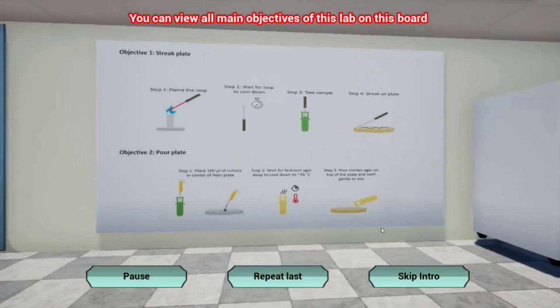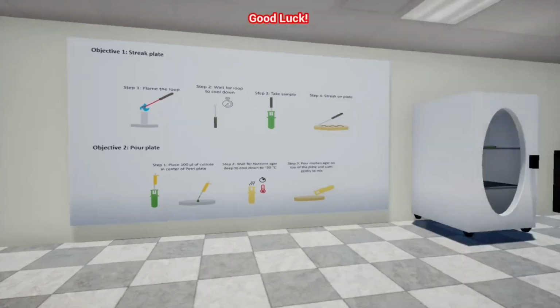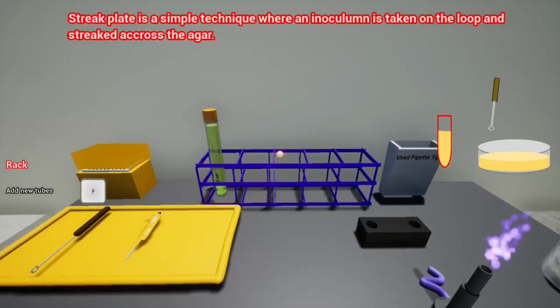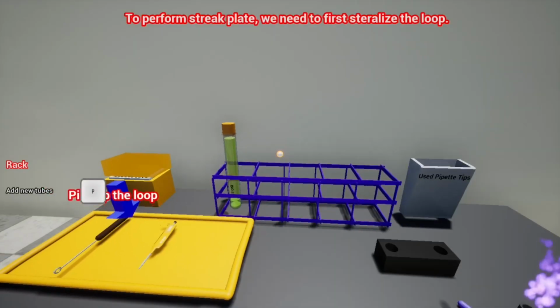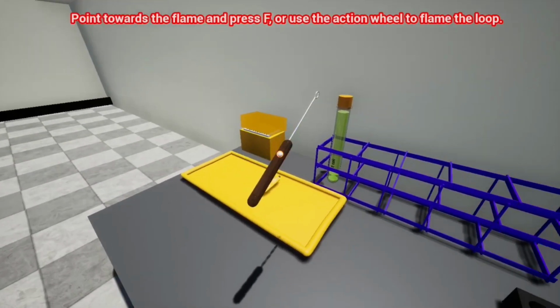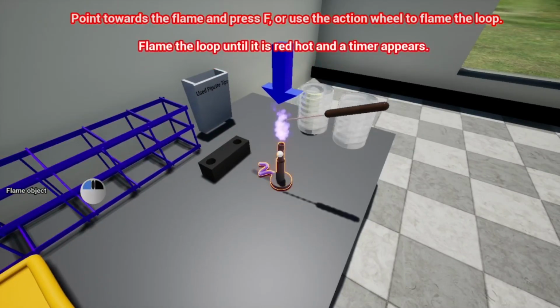You can view all main objectives of this lab on this board. At any time, press the escape button and use the menu bar to repeat instructions, read the lab manual, or submit the lab. Good luck! Streak plate is a simple technique where an inoculum is taken on the loop and streaked across the agar. After incubation, bacteria can be seen on the surface of the agar. To perform streak plate, we need to first sterilize the loop. Okay, so we're just gonna pick it up towards the flame and press F, or use the action wheel to flame the loop. So again, point and just press F.